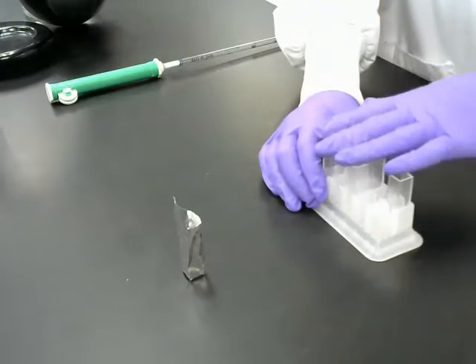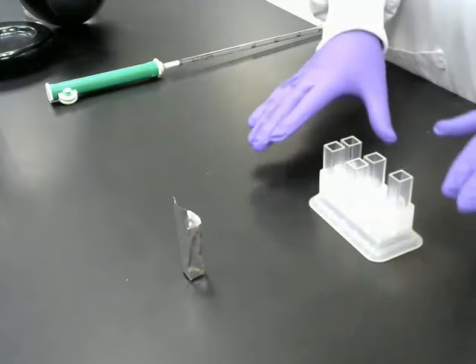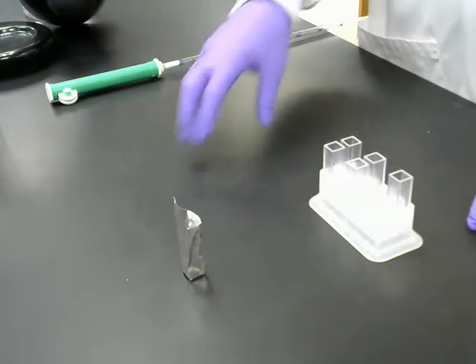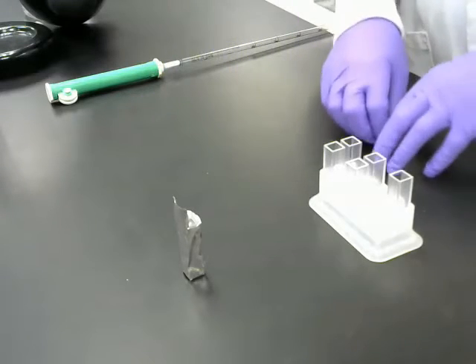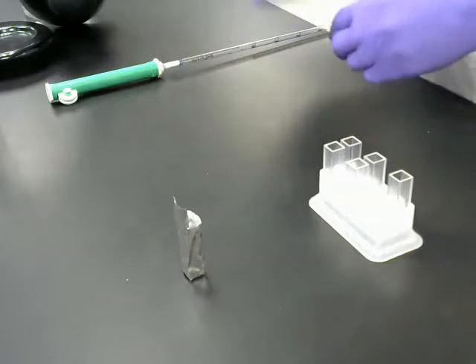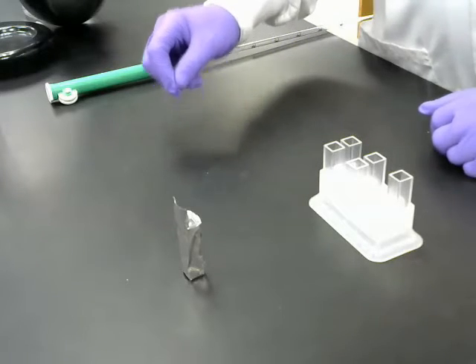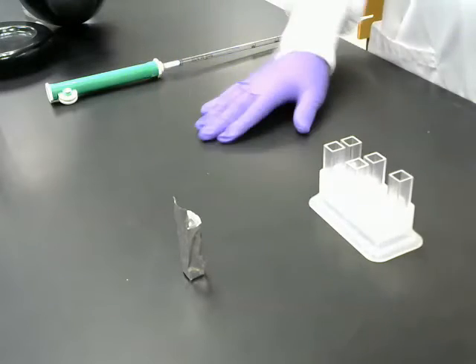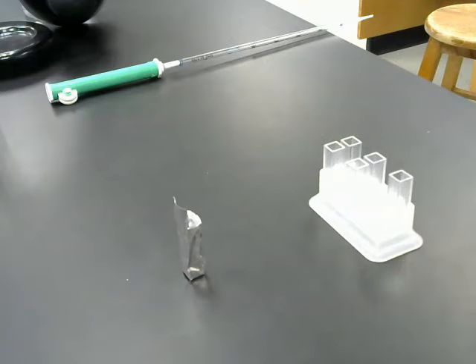Right now we need to get our cuvettes all set up. So I'm going to put everything into these cuvettes, into each cuvette that's needed except for the chloroplasts. The chloroplasts are the very last thing to go in. When we get ready to actually run the experiment, you'll see I'll put chloroplasts in, give it a mix, and immediately measure it for time 0 and set it in its place. So the chloroplasts are the last thing to go, but everything else can go in now to get prepared for that.